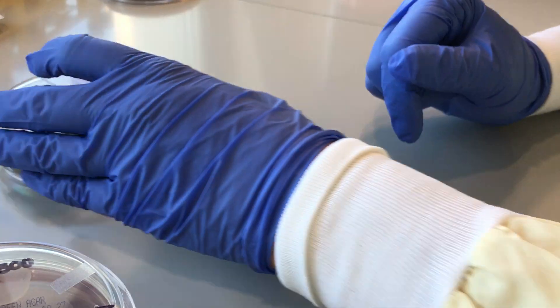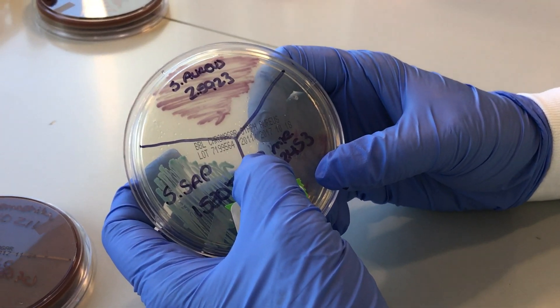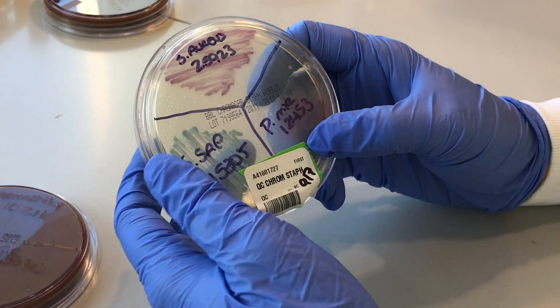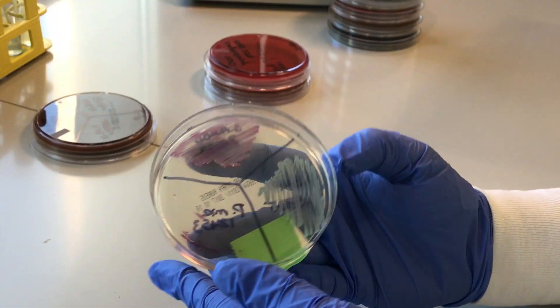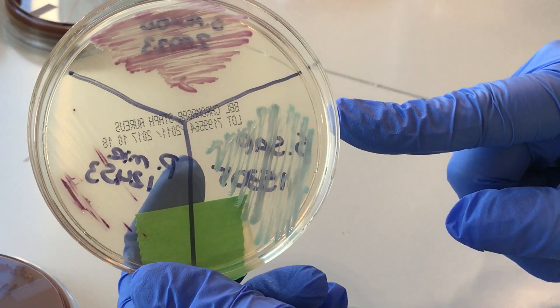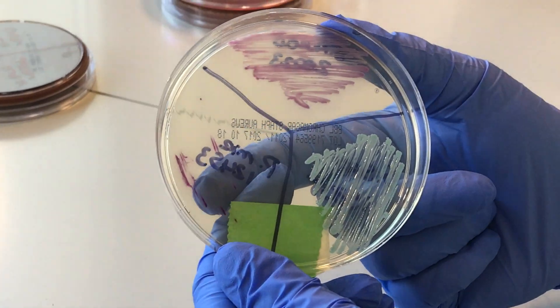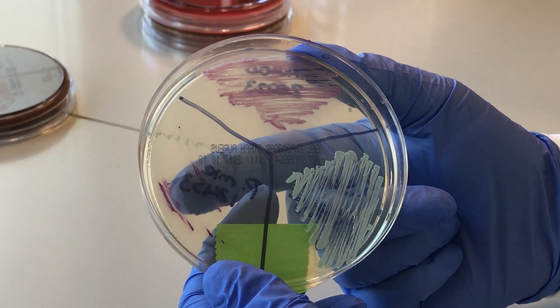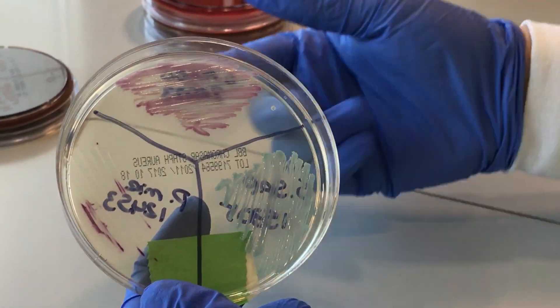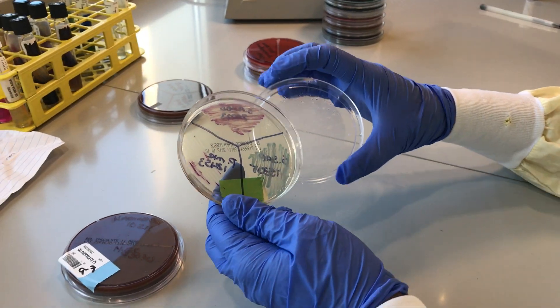We have chromagars, which turn different colors for different things. This is a staph chromagar. If it's staph aureus, it will be lavender. If it's some other staph, it'll be a different color. As you can see here, the staph aureus is lavender. Staph saprophyticus is blue. This is Proteus mirabilis, which isn't really supposed to grow, but it'll grow — it doesn't grow well, whereas the staph really grows well. You're looking for lavender or pink for staph aureus.